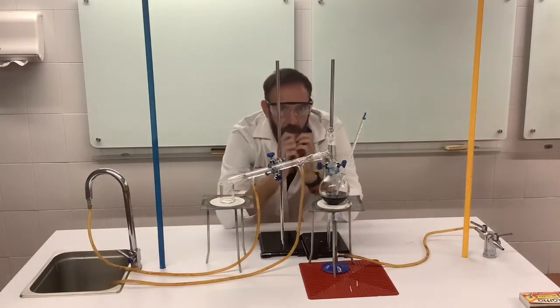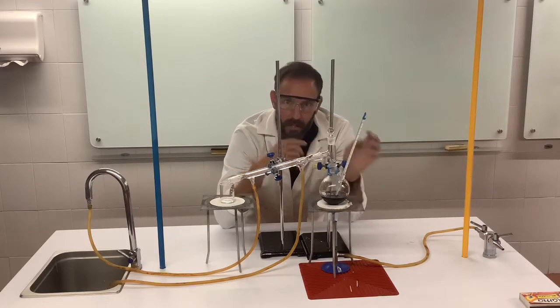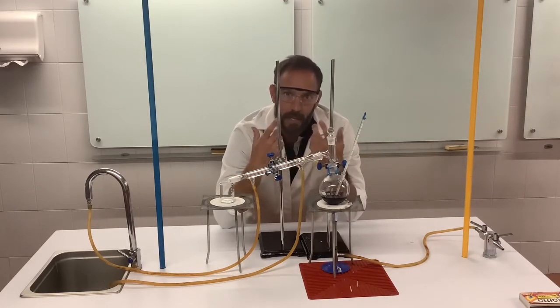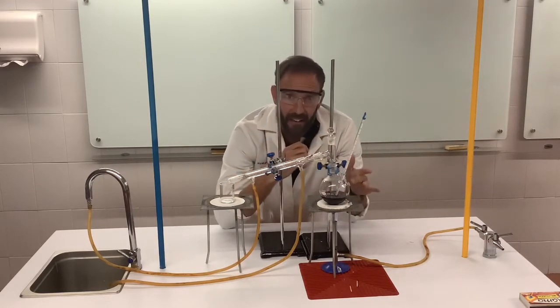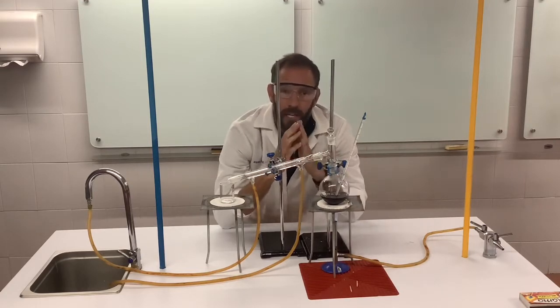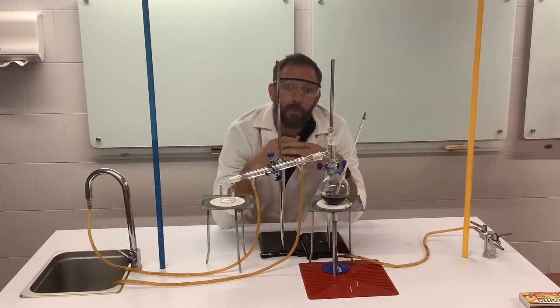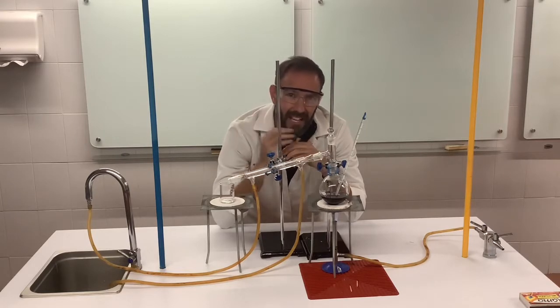Okay. So this may take some time, so I may cut the video to when we get this in action here. But let's make a couple of minutes. We have wine in here. We're separating out wine. Wine is a mixture of water and alcohol, ethanol. Ethanol has a boiling temperature of around 78 degrees Celsius. Yeah?